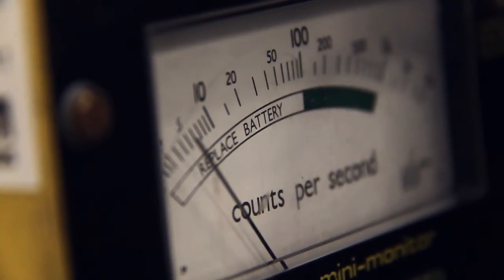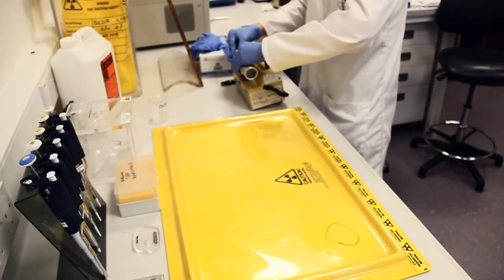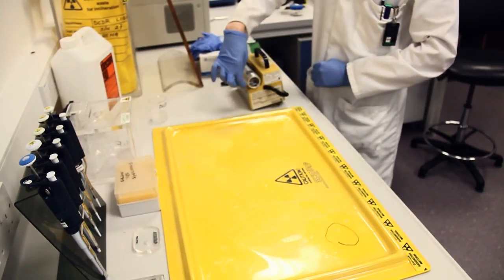The monitor shows no contamination on the workstation, so David proceeds to monitor the tweezers, his hands and his front.